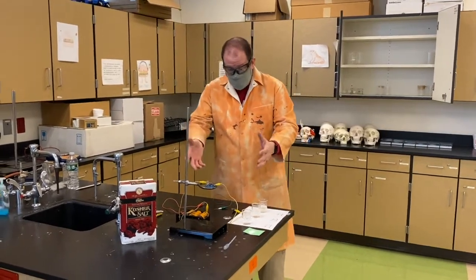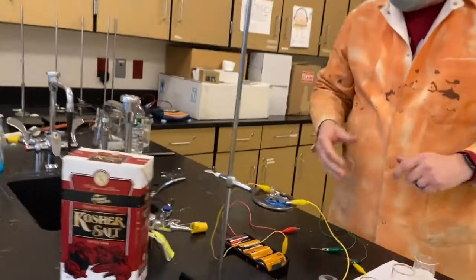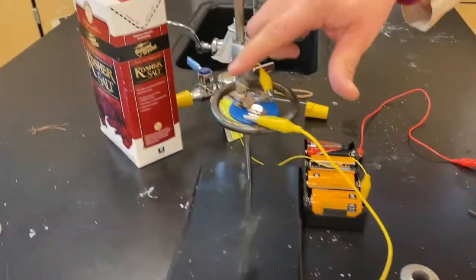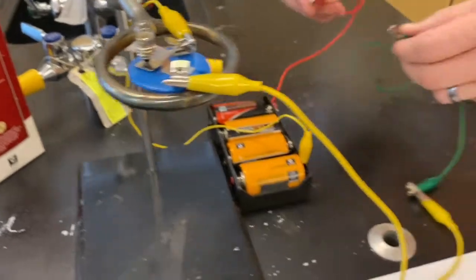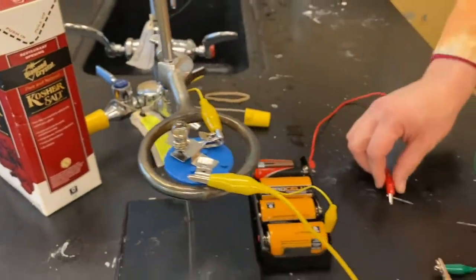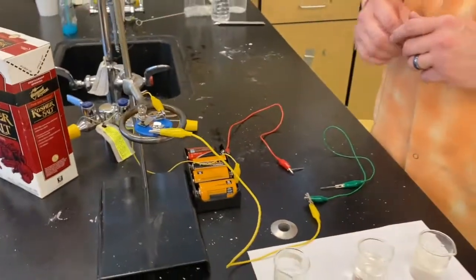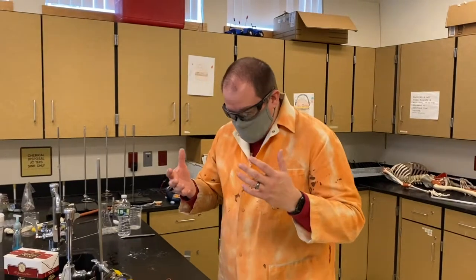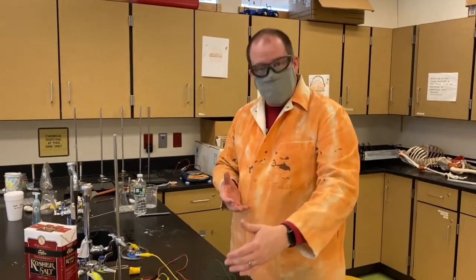So if you come and take a look at our simple setup we have here, we have a standard little power supply, completing a circuit to a light. And if we get a nice good connection, you see that our flow of electrons are able to transfer all the way through and give us our bright light. Now, the idea behind this property is it has to be in a dissolved state.